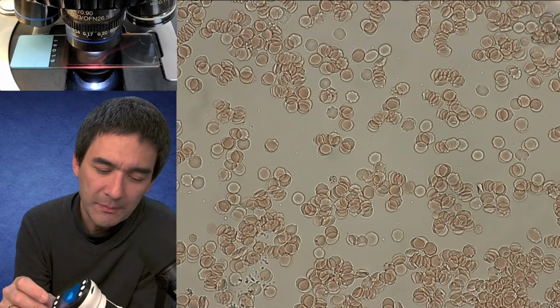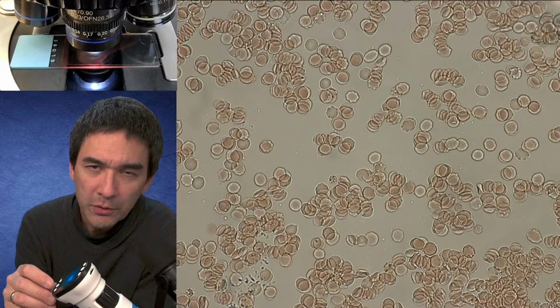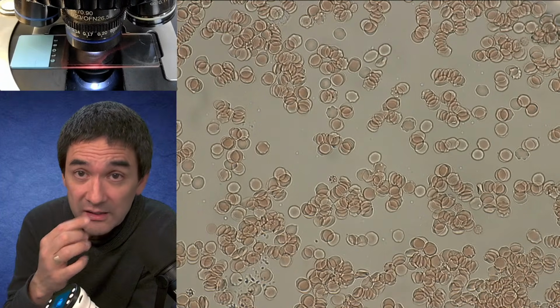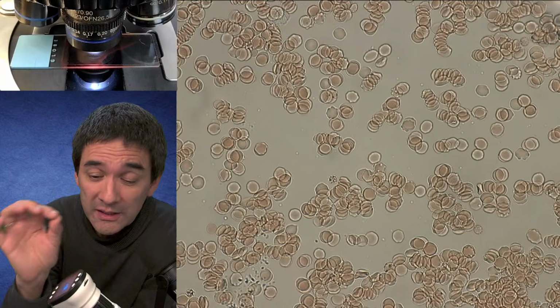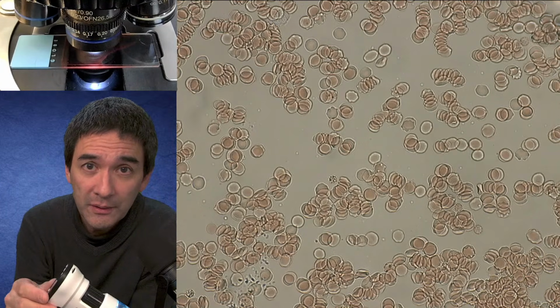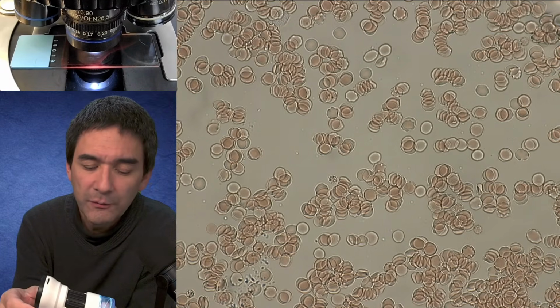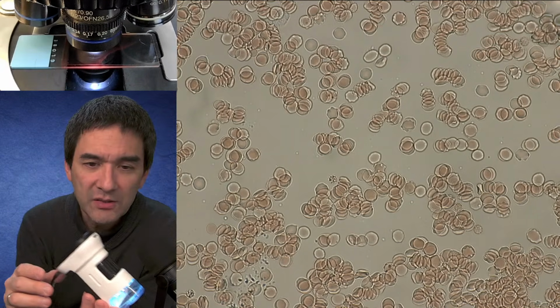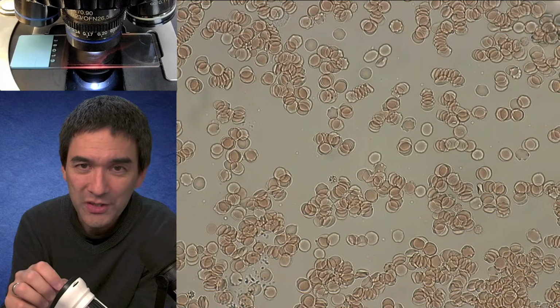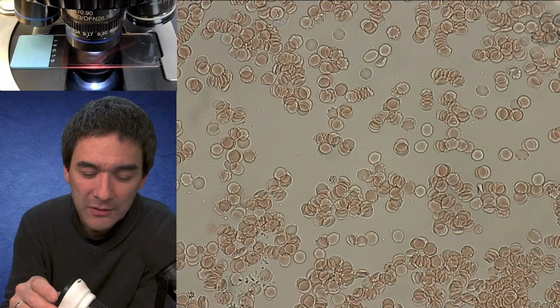I'll tell you the following reason. When I go on holidays and we're going to a beach, I like to put beach sand under the microscope because sometimes you do see interesting things in there, tiny microscopic shells and so on. But taking along sand samples is not always allowed. Sometimes it's pretty heavily fined if you do that. For this reason, I thought I'm going to take this along to take pictures of sand and other structures as a kind of microscopy souvenir of the holidays. So this was the intention.